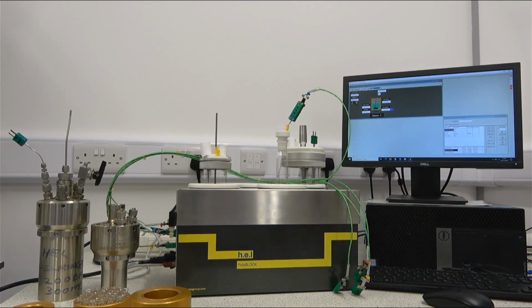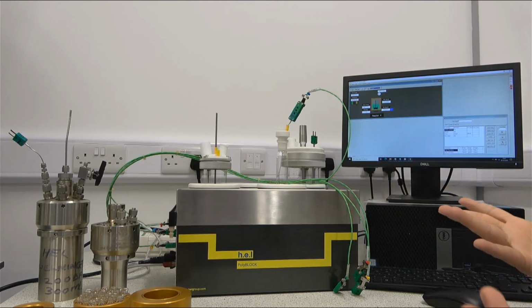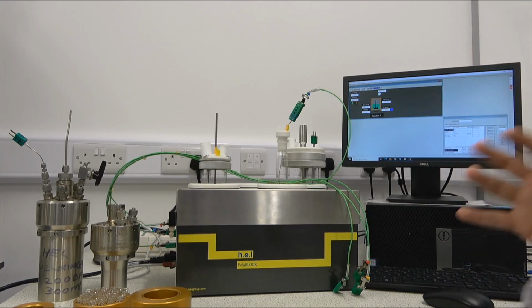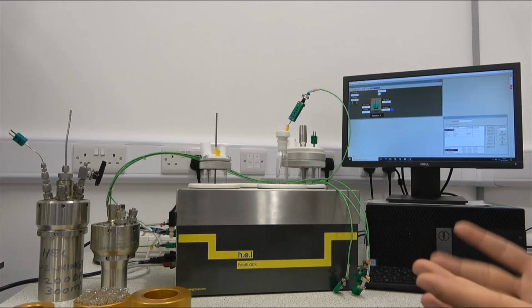You know, the typical sound when you have a fluid that is just moving around inside of the reactor and it makes that clinkety clanky sound. However, to avoid that, WinISO is able to test the coupling between our agitation inside of the vessel and our PolyBLOCK, and it is able to ensure and reconnect the magnetism in a way that we are going to avoid this decoupling. We have other sizes as well.